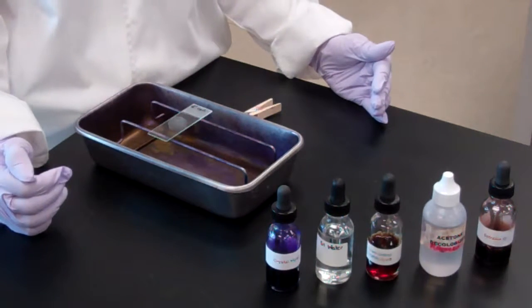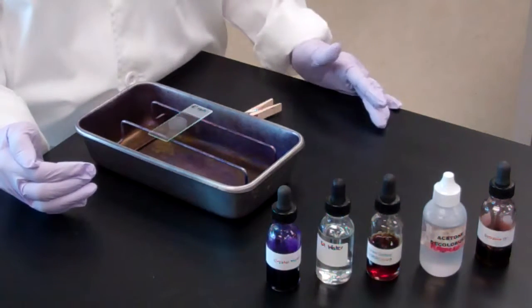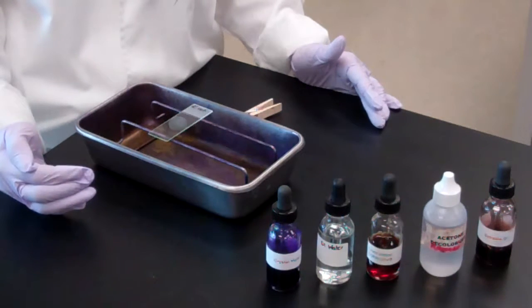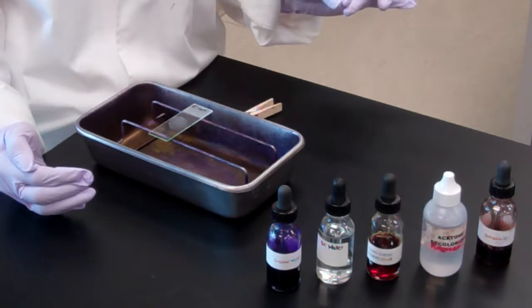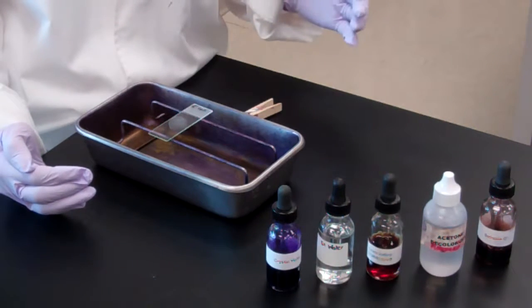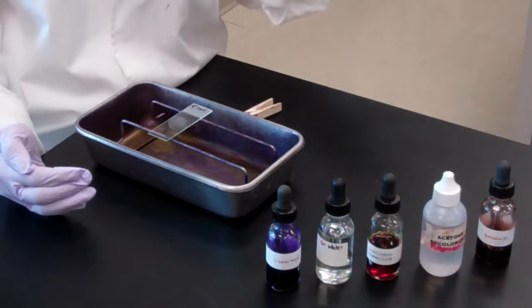So this is why we call it a differential stain. We're differentiating bacteria from one another. To recap the difference between gram-positive and gram-negative bacteria, remember gram-positive and think P for positive: there is a lot of peptidoglycan. Because of that increased peptidoglycan, gram-positive bacteria appear purple. So remember the 3 Ps: gram-positive, peptidoglycan, purple.